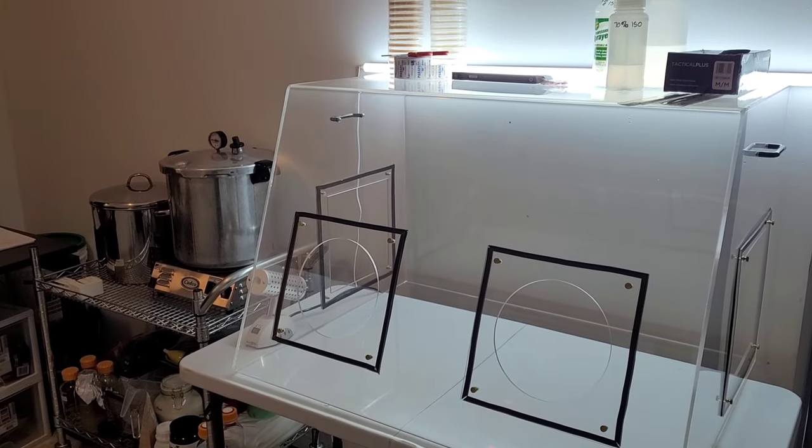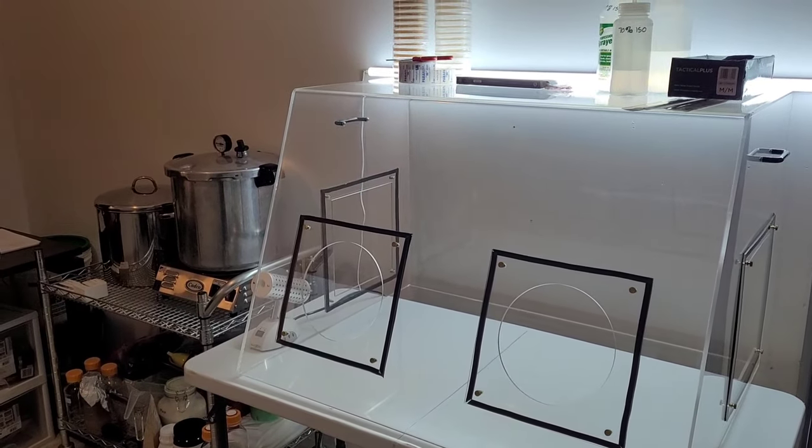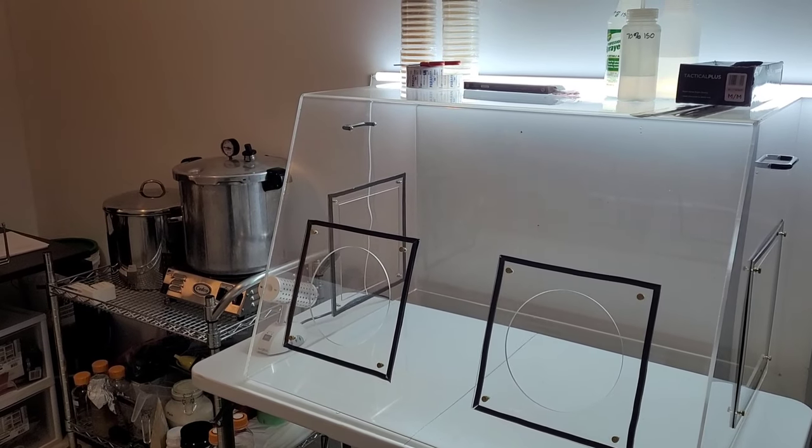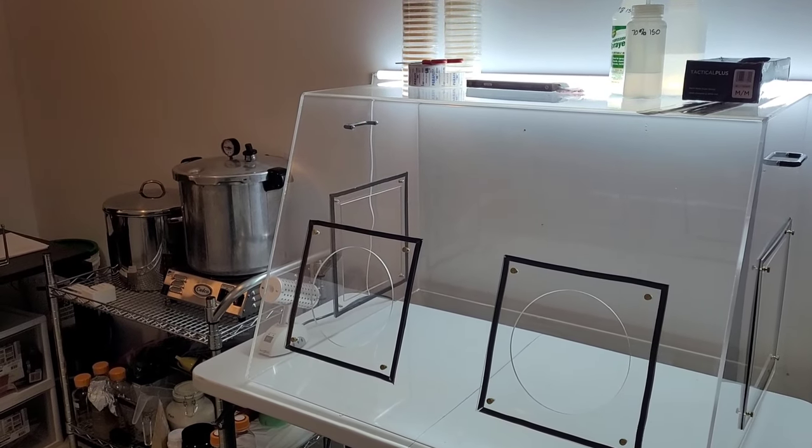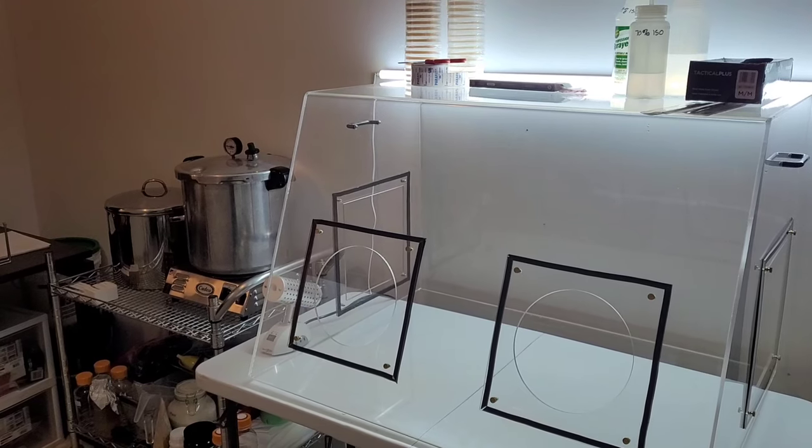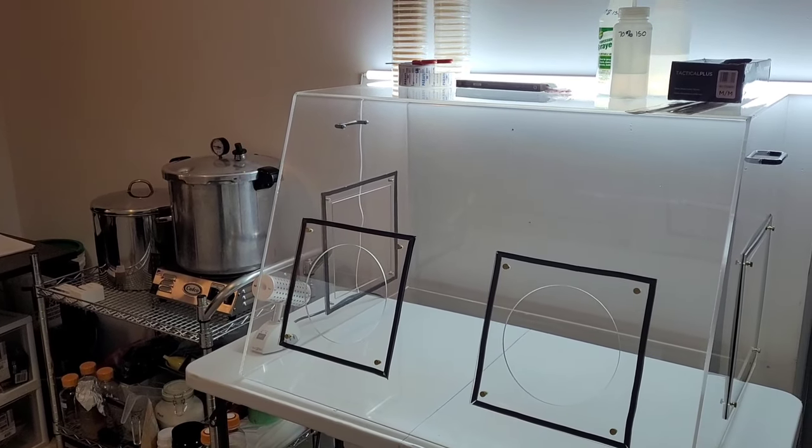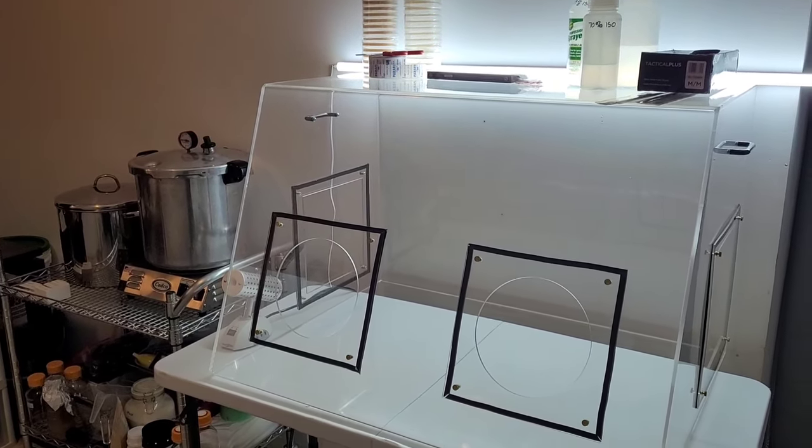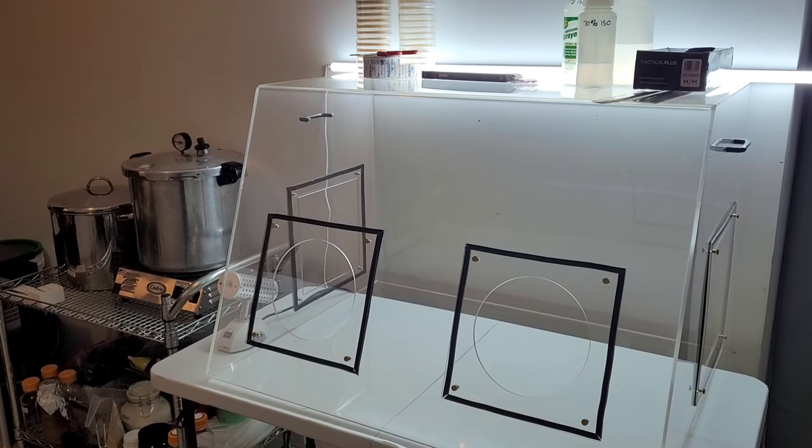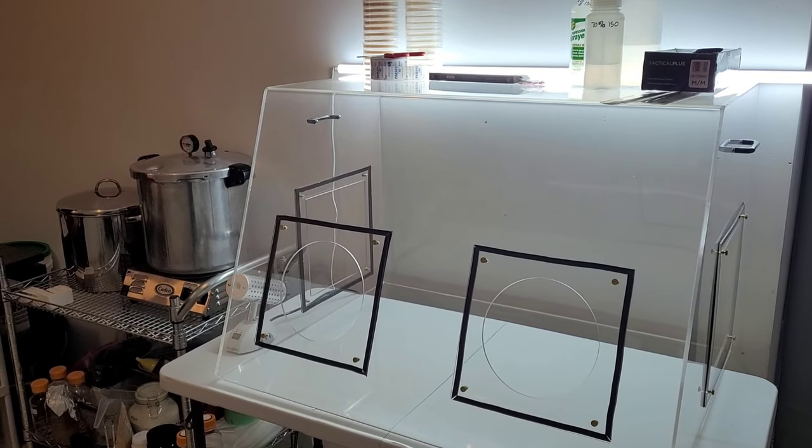Today I'm going to go over the basic function and operation of a still air box. Now some people assume the abbreviated SAB stands for sterile air box, and that's just not the case.